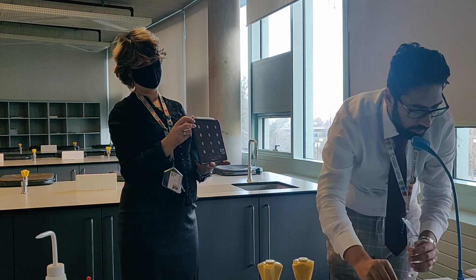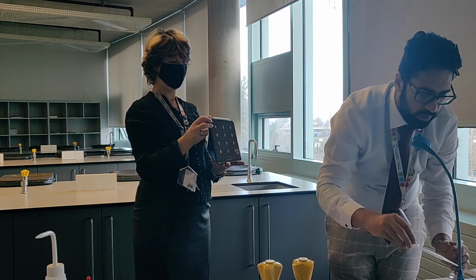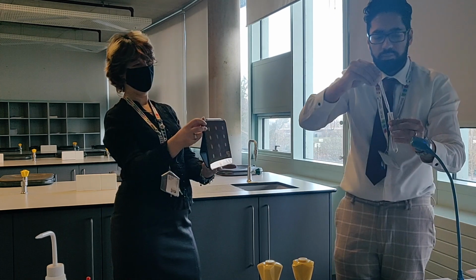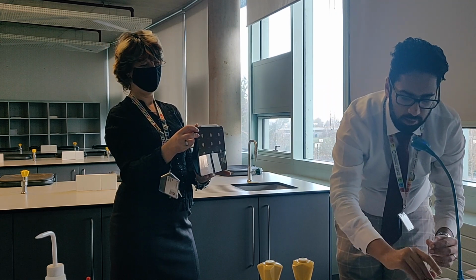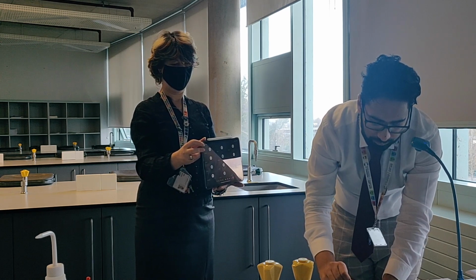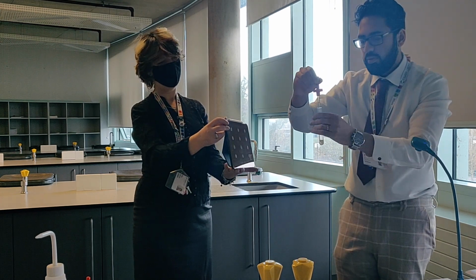That's enough. Right, magnesium sulfate, followed by an equal amount of hydrochloric acid. So 1 centimetre cubed again. And then you're going to add barium chloride to it as well. And again, the same amount, equal volume. And then just record the observations.